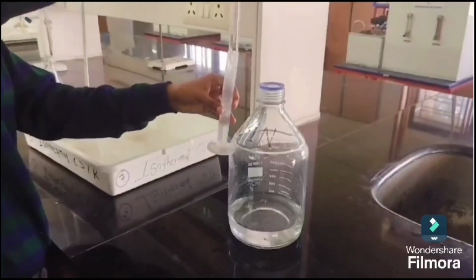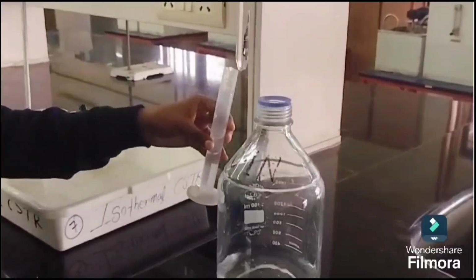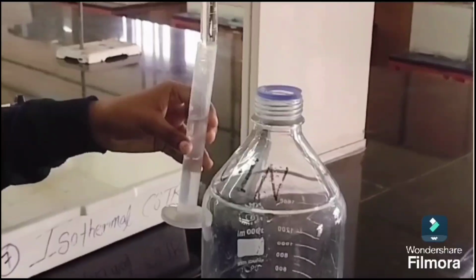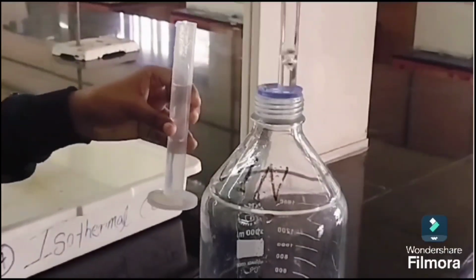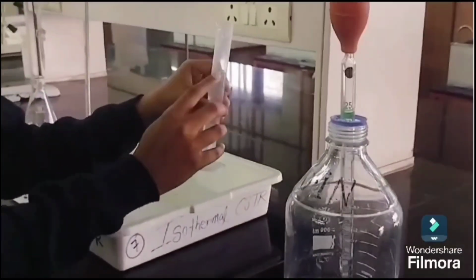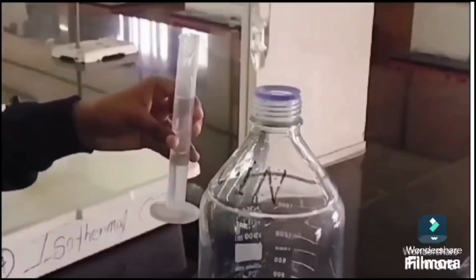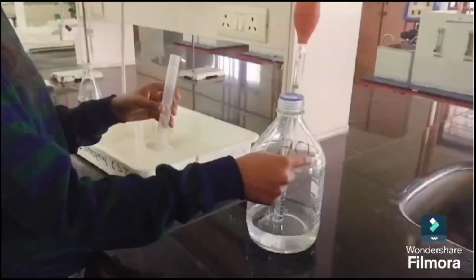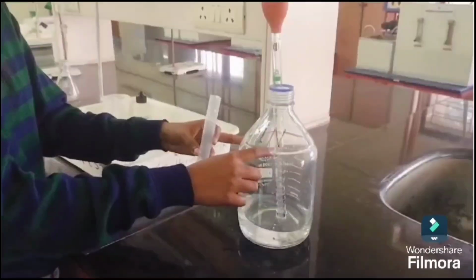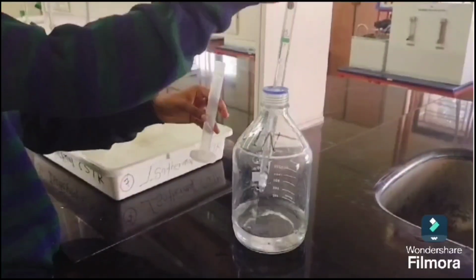Here, why are we adding HCl to the sample? For initiating the reaction. HCl might act as a catalyst for the reaction being studied. Many chemical reactions, especially in aqueous solution, require an acidic solution to proceed or to increase the reaction rate. For example, HCl can protonate reactants, making them more reactive. And for maintaining pH control. Some reactions are highly pH sensitive and adding HCl ensures the solution stays within the desired acidic pH range. This is crucial in kinetic studies to isolate the effect of other variables.